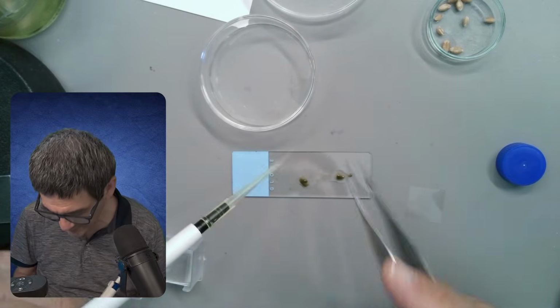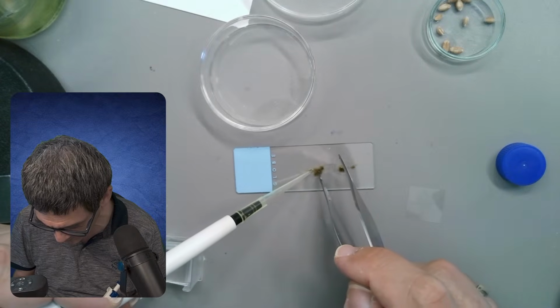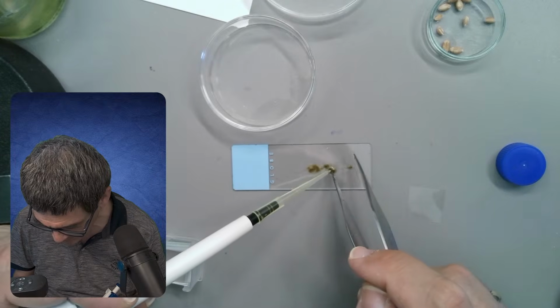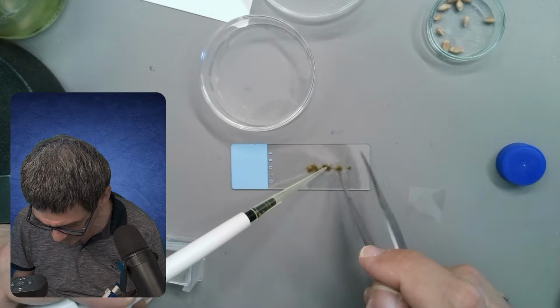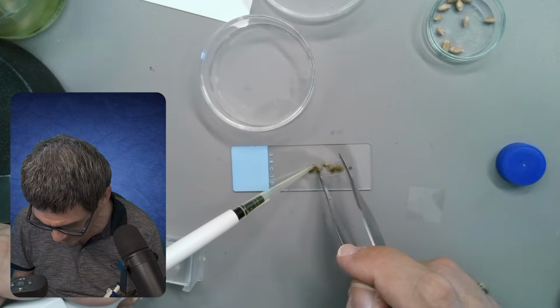And what we're doing right now is I'm just going to take it apart.